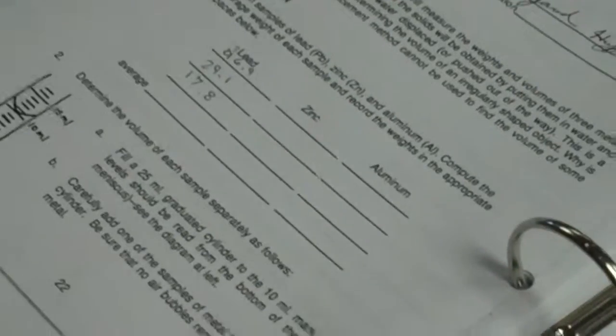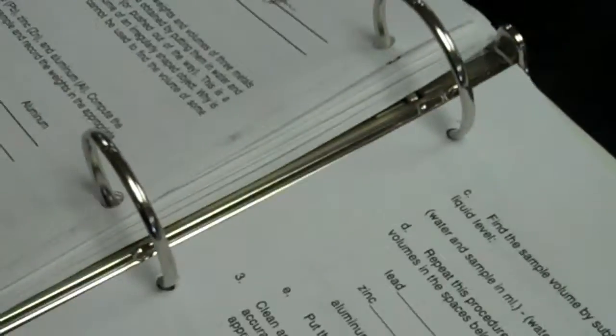Okay, so the weight or the mass of the lead you have is 17.8 grams. So now we can put that to the side. We can go ahead and do the same process for substance number 2, which is going to be zinc. So that's the beaker number 2. And as we look in at the zinc, we notice this is the irregularly shaped object it was discussing.